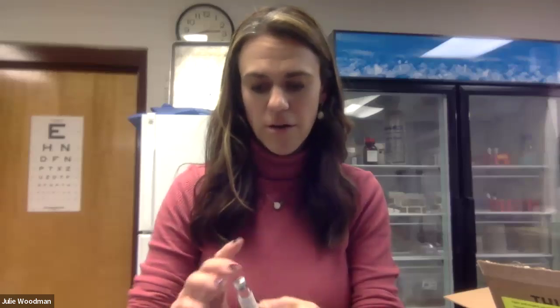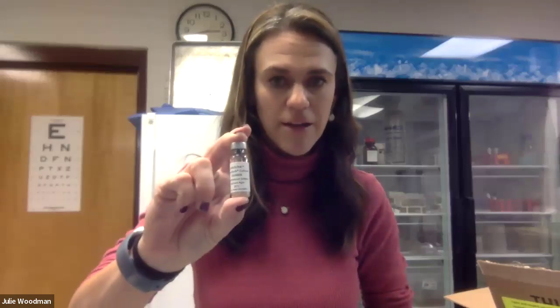Once you set up your test tube rack, you are ready to begin. The goal of Day 1 is to take your powdered, lyophilized bacteria and get it growing in liquid culture again. These bacteria take a couple of days to adjust to their surroundings and get a feel for their new environment before they're growing really well, and you want them growing well before you conduct any additional experiments.